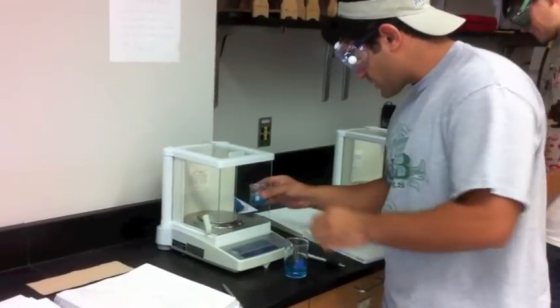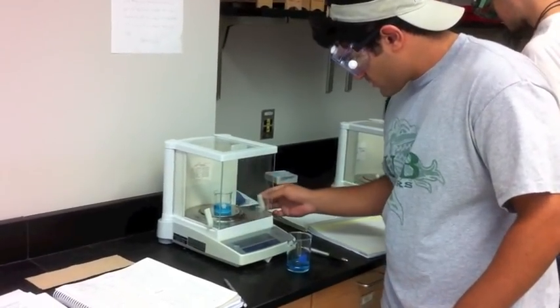Now you tare it. Keep writing because I don't know how pretty that is. You get about 47.39. Write it under the mass.